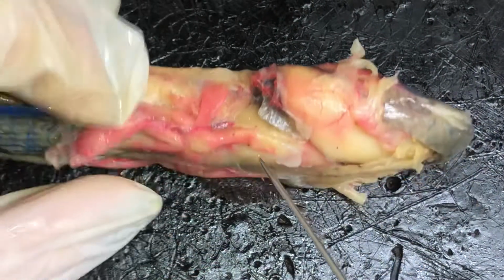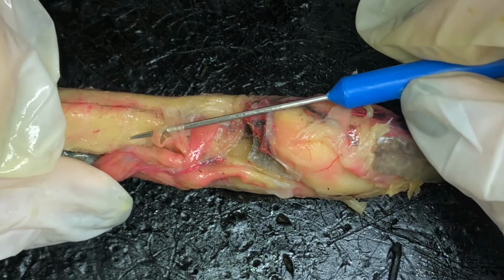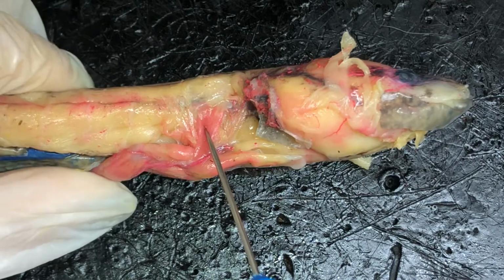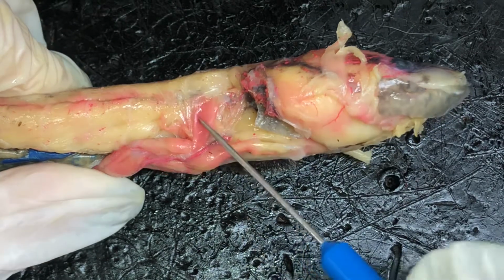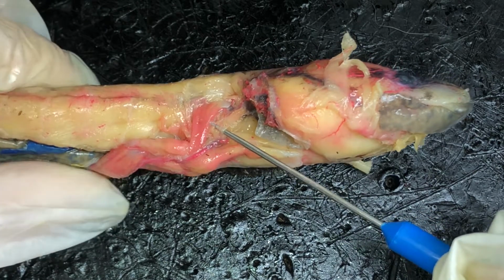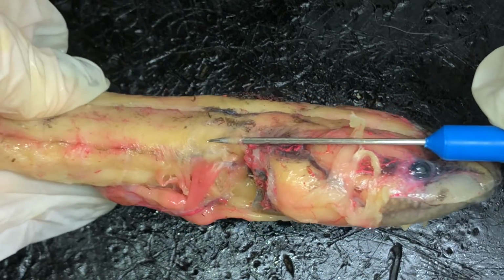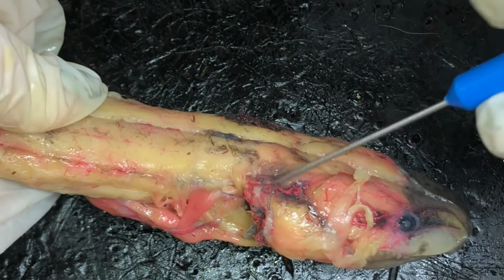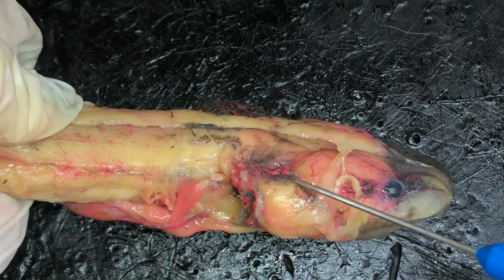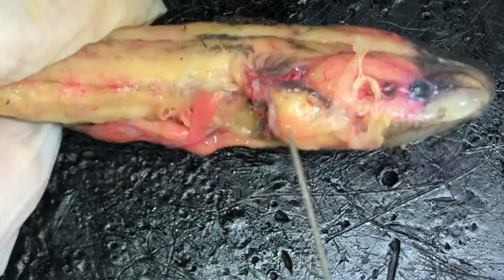Moving this way, in the arm muscles, we have the latissimus dorsi, right here. We have the dorsalis scapulae, right here. We have the cucullaris, which is going to be this muscle right here. And then we have the dilator laryngeus, which is this muscle right there. Next to the dilator laryngeus is the levator arcuum. This muscle right here, also seen over here, is the levator arcuum. Okay, that takes care of everything up here.